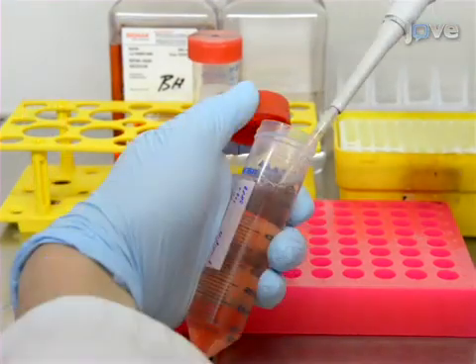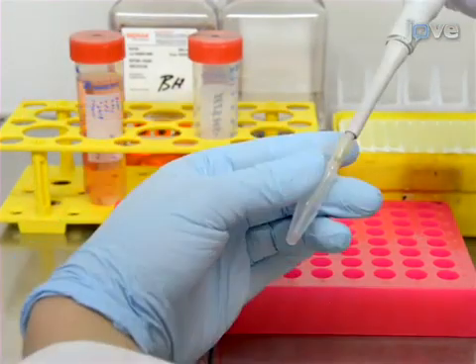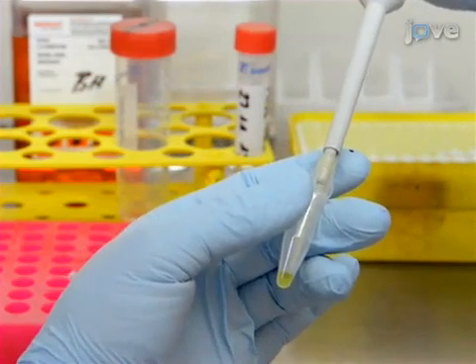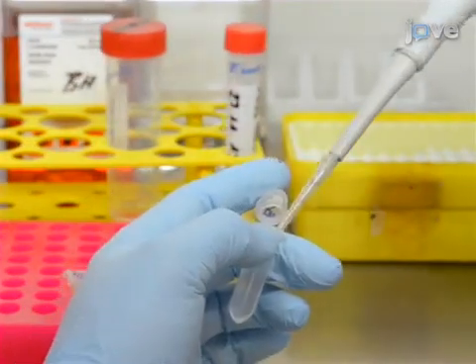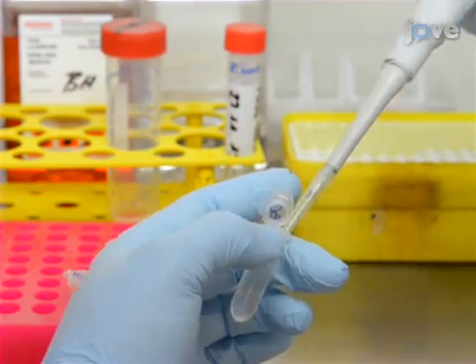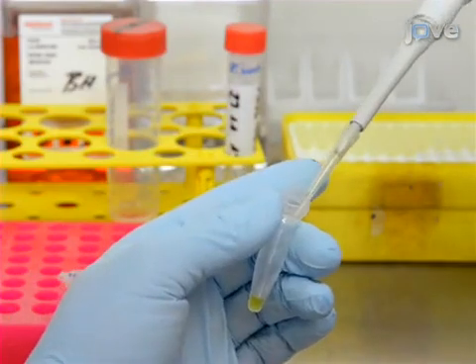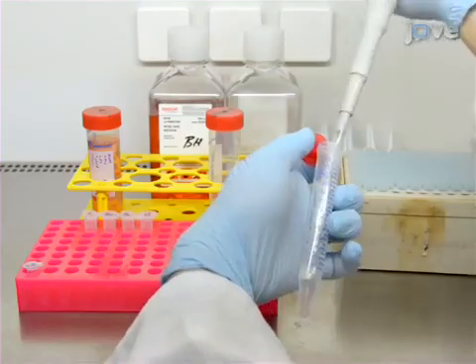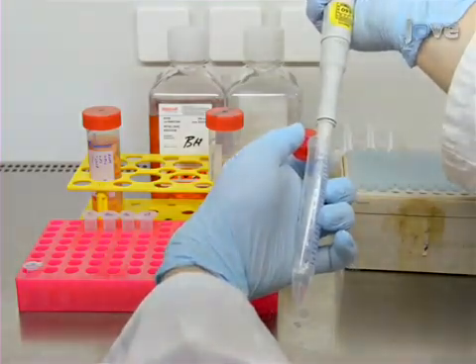For the collagen suspension, combine 50 microliters of 10x MEM and 27 microliters of 7.5% sodium bicarbonate solution. Mix thoroughly, then add 375 microliters of liquid collagen suspension and mix.